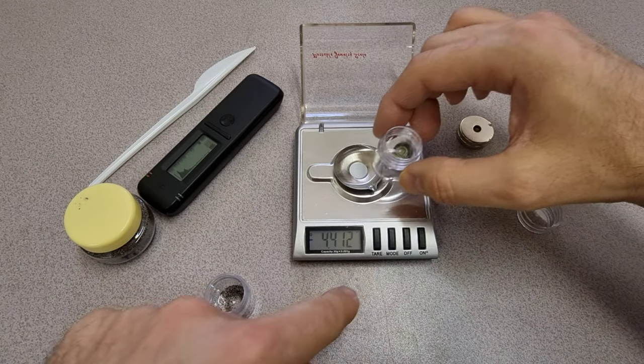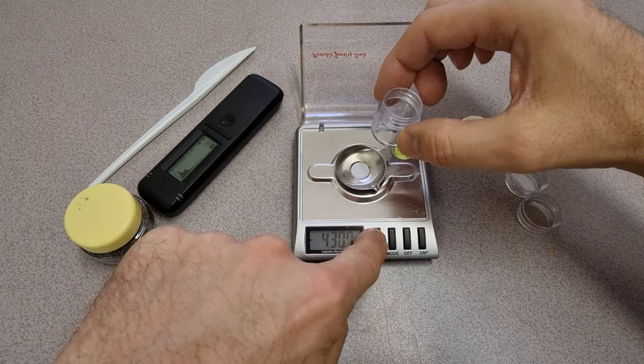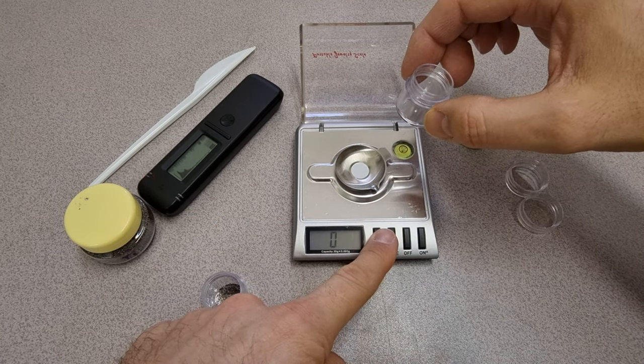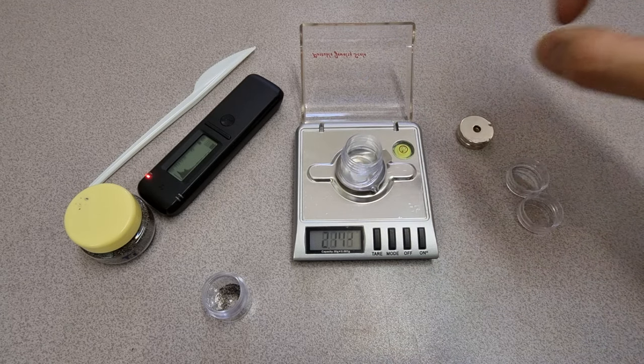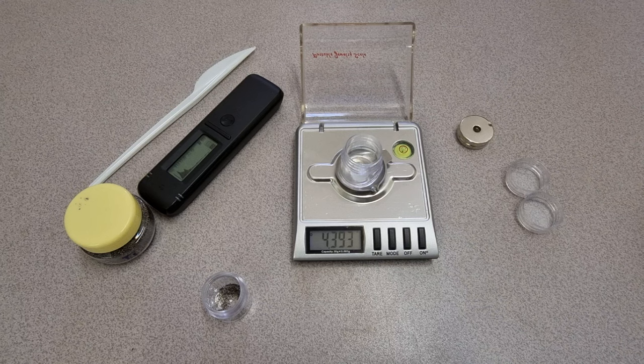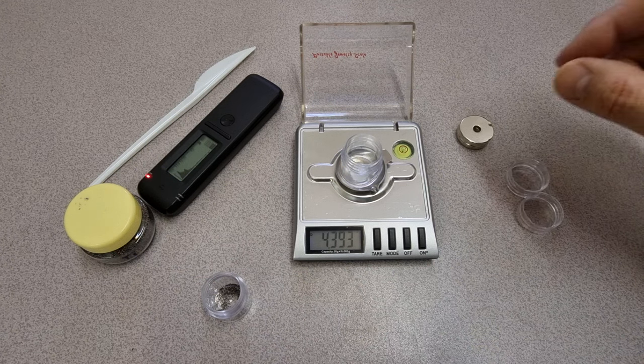And the container is, tare that, 4.393 grams. So we'll take that and we'll move that out of the way.